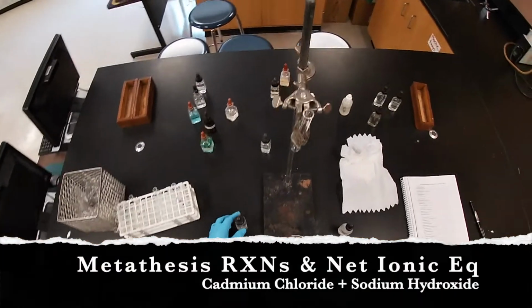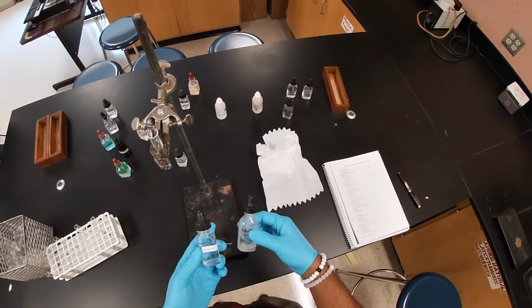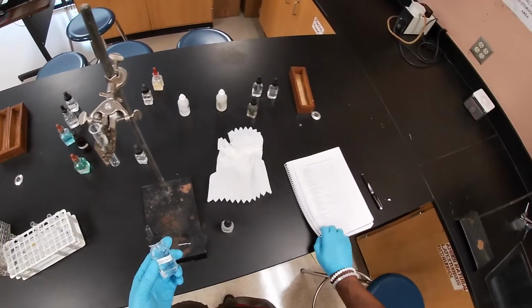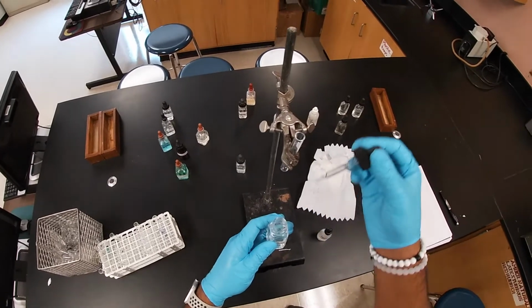The next reaction is between cadmium chloride and sodium hydroxide. And so here this is, I believe, reaction number 7, if I'm not mistaken. Yep. Reaction number 7. Let's go ahead and get some cadmium chloride.